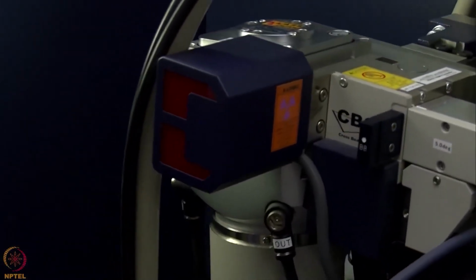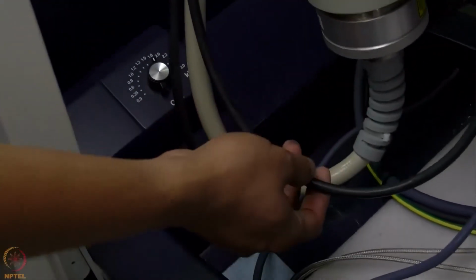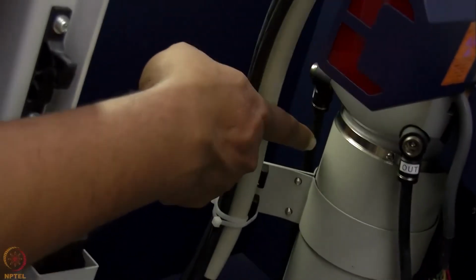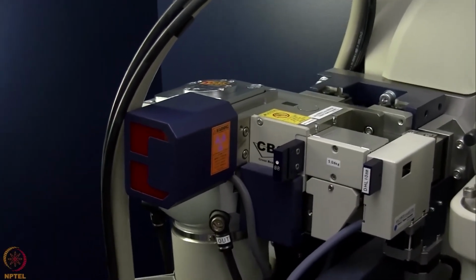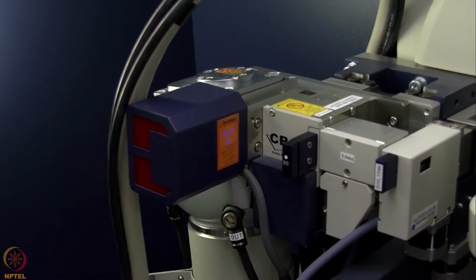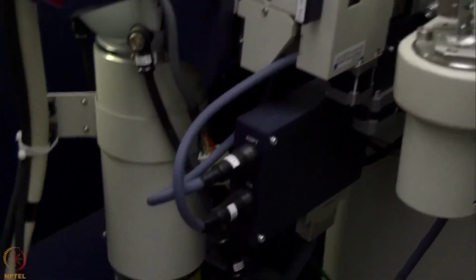So in this X-ray tube, we need to cool the anode, which is at the back of this tube. To cool that anode, we have water supply coming through these tubes which are here. This is the tube through which the hot water is going back, and there is a tube inside here through which the cold water is coming in. We have a chiller in a different room which cools the water to about 16 to 17 degrees centigrade and then runs it through the tube at about 4 liter per minute flow rate, so that the cold water comes, hits the backside of the anode, takes the heat and goes out to the chiller.